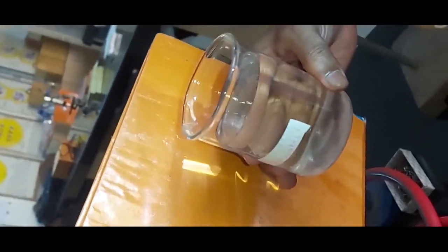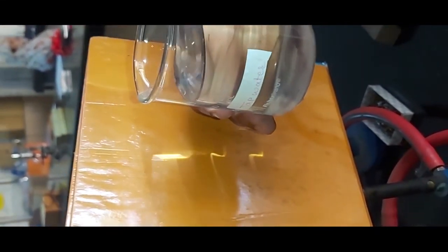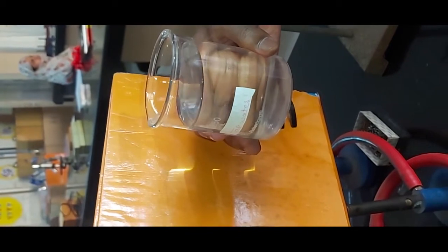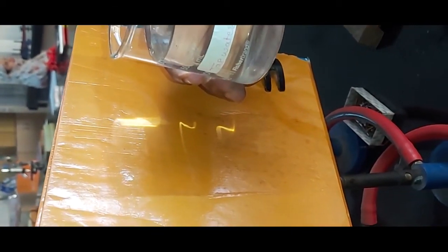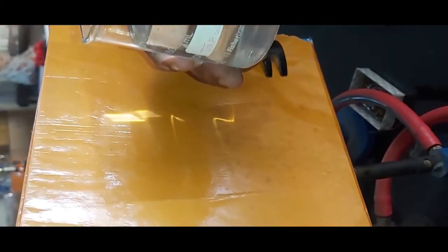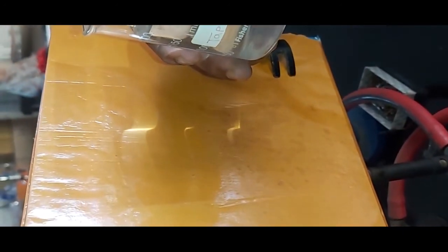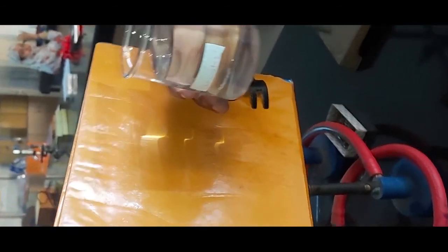The third one is tap water. In tap water, if the water sources are from open lakes, ponds, or dams, then definitely there will be more sedimentation — that is, the particulate matter will be more. Hence the image getting formed is not clear as compared to swimming pool water and distilled water. So it will be more turbid as compared to both distilled water and swimming pool water.